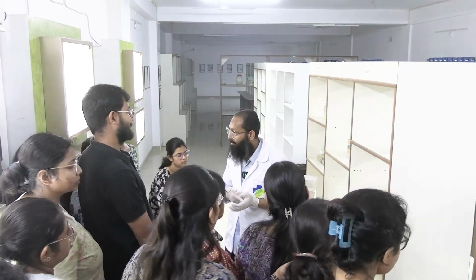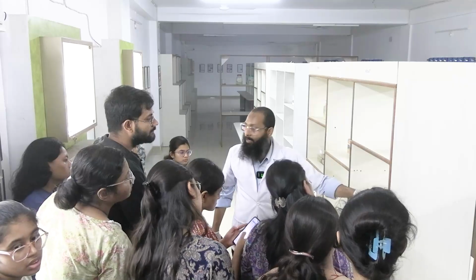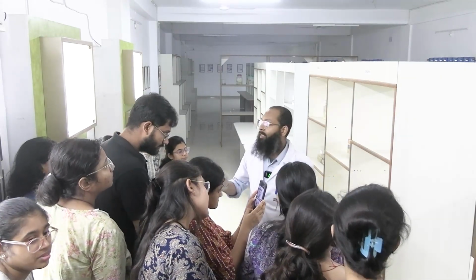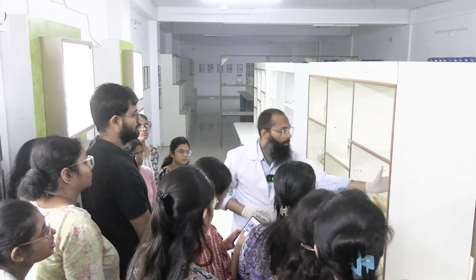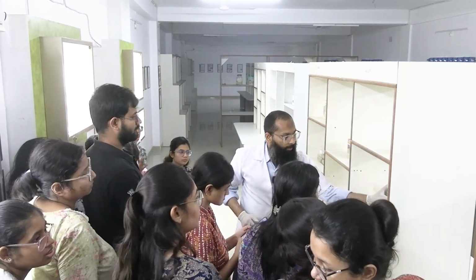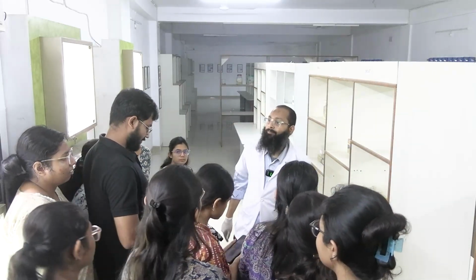ঠিক আছে, তো সেটা দেখার জন্য আমরা ওখান থেকে সেকশনগুলো নিই। Now next we take section from the nipple areola complex. ওকে, এই যে সেকশনটা নেওয়া আছে, তার জন্য এটা ডিস্টর্টেড হয়ে গেছে নিপলটা। ক্লিয়ার? So the section is again taken from this area and then we go for the lymph nodes. Okay, ঠিক আছে, clear? So these are the things which we follow in case of breast specimen. ঠিক আছে, ক্লিয়ার হয়েছে? এবার you please describe this specimen.